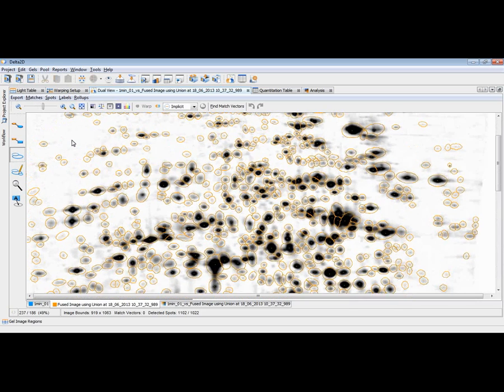Furthermore, we can zoom in and have a look at whether the spots are detected properly. For this, I could choose the zoom tool now, or keep the spot selection tool activated and use the control key and my mouse wheel to zoom in to a certain area where I'm pointing. What we recommend is to really check this spot pattern very carefully. You do this just once on one fused image, typically, and for this reason, it might take up to an hour or even 1.5 or 2. Be careful and optimize it, so that you are really satisfied with the quality of this pattern. This is the pattern that will be applied to all the other images later on.